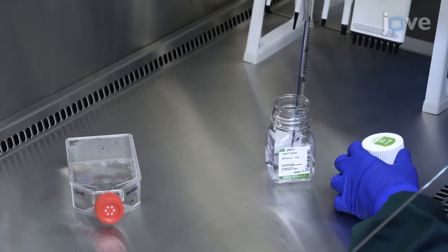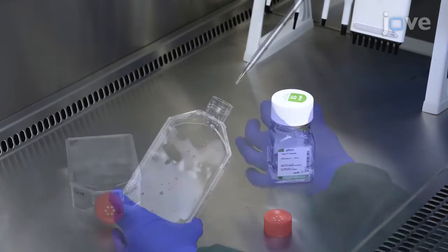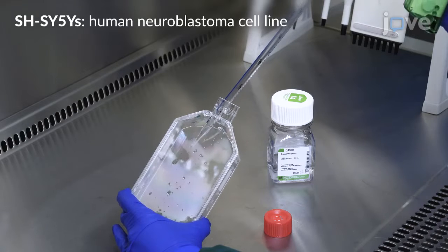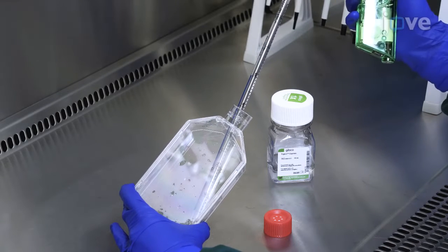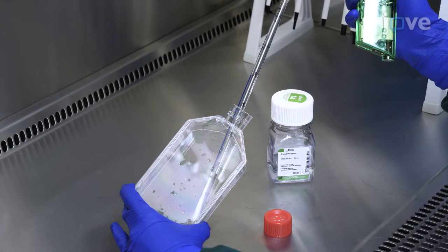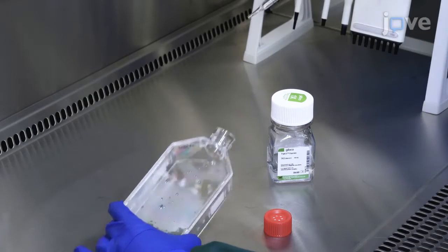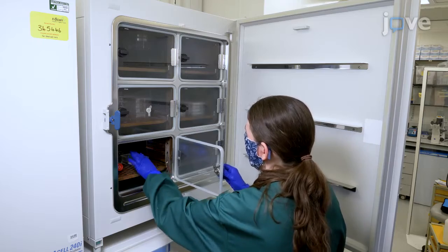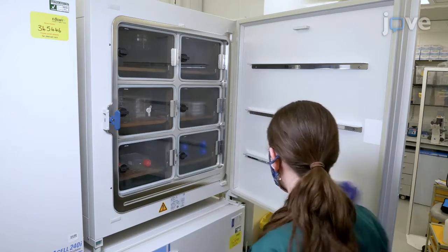In a Class 2 biological safety cabinet, dissociate SH-SY5Ys by aspirating the media. Add 4 milliliters of cell dissociation buffer and remove the buffer immediately so that less than 1 milliliter remains as a thin film coating the cells. Incubate for 2 to 3 minutes at 37 degrees Celsius and 5% carbon dioxide.